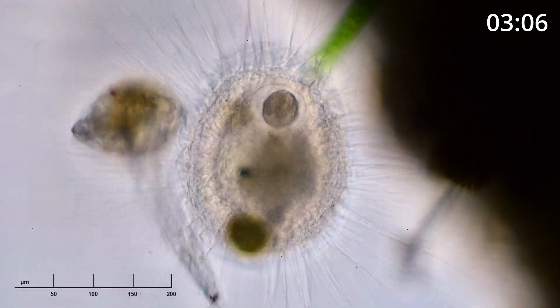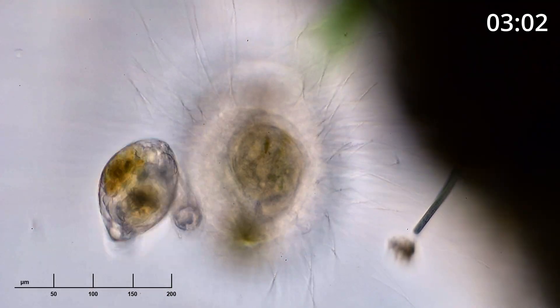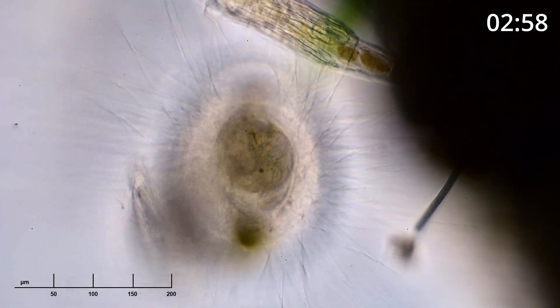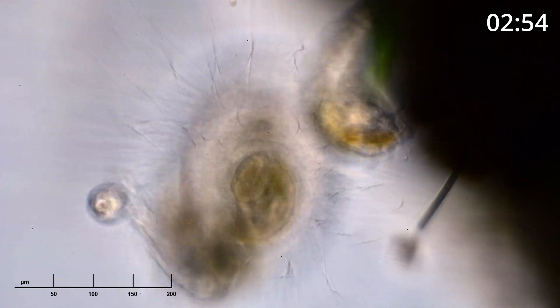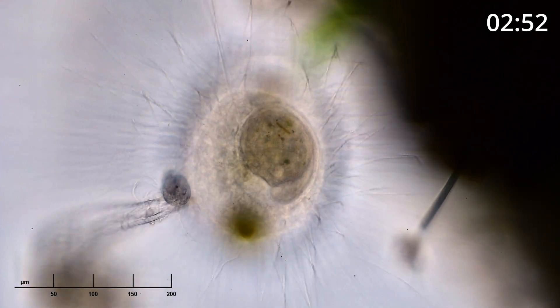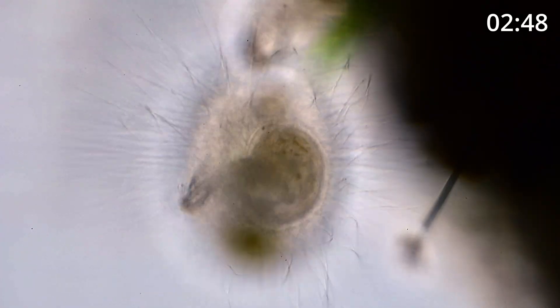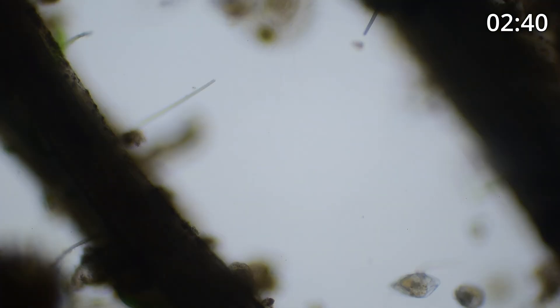I don't know what this is, and I don't know if this is something that the heliozoan has eaten or if it's something that is eating the heliozoan from the inside. Maybe one of the viewers can give me an idea of what this is — I don't recognize the shape. Usually by the time something is absorbed it's really not moving much anymore, if it's being eaten.